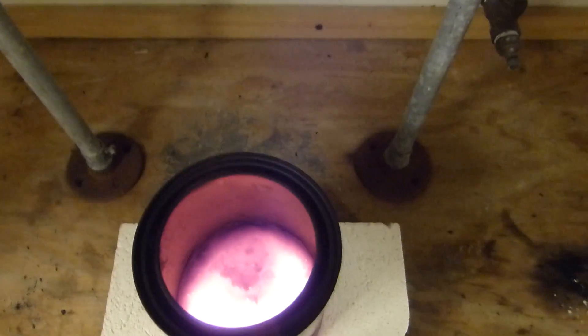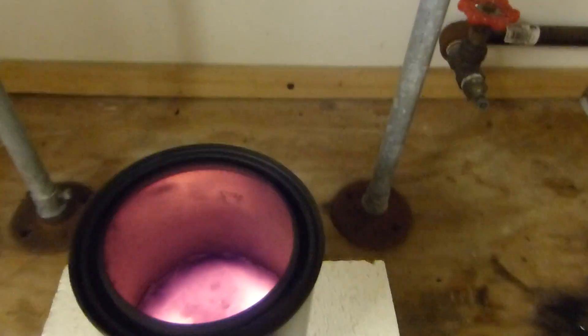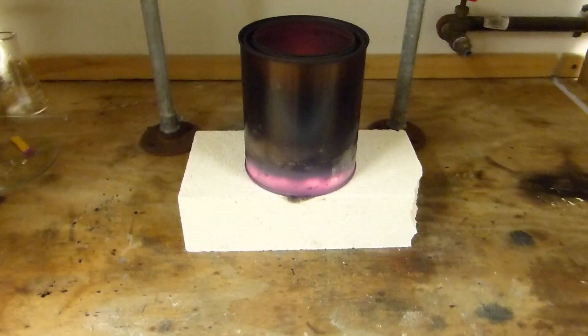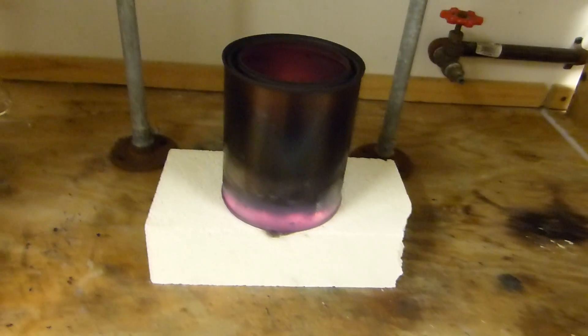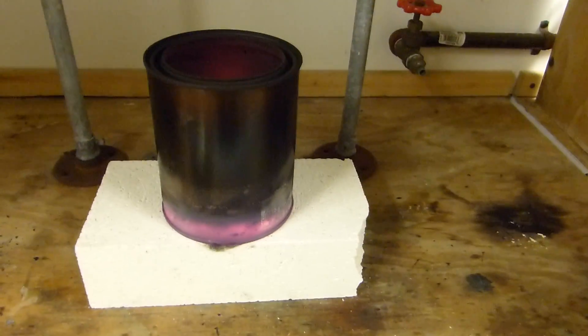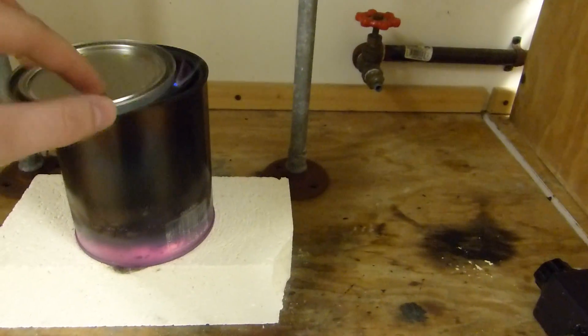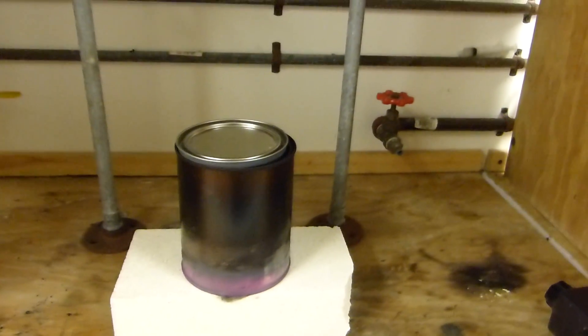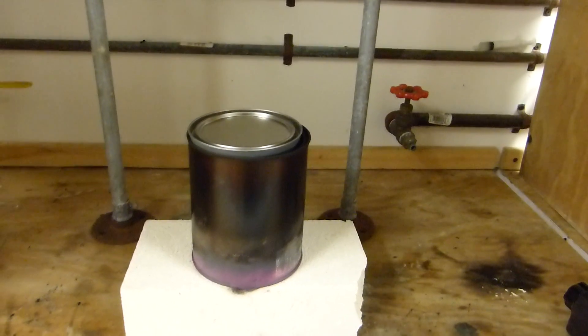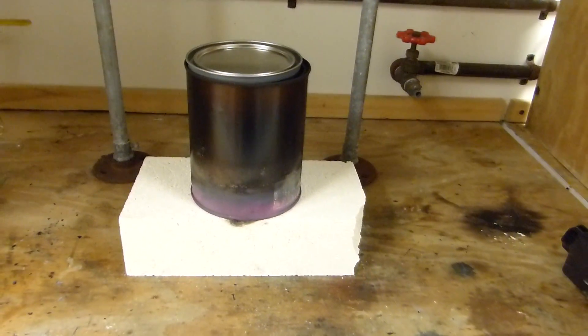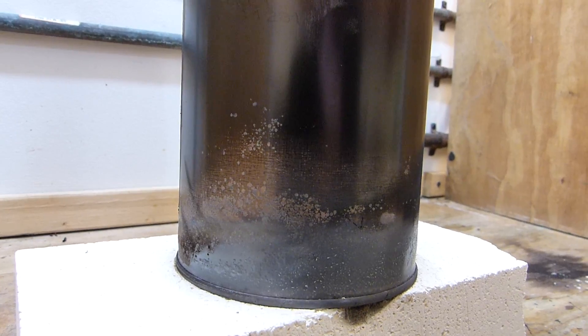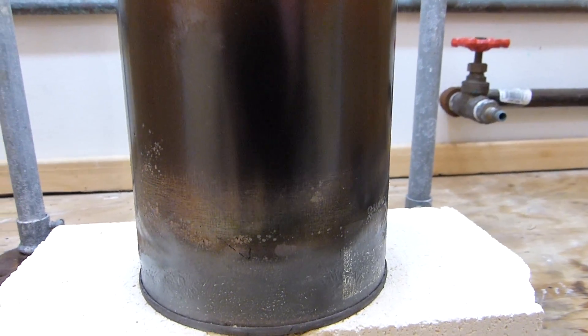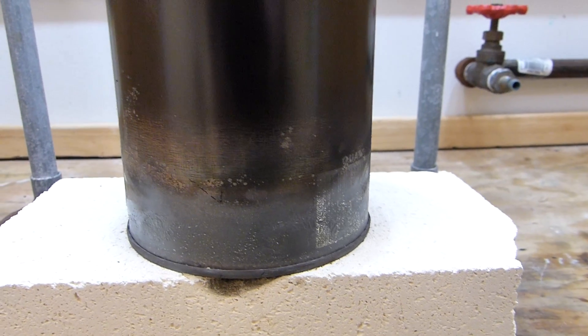And in there we should be able to see, yep, there's some really hot iron sulfide. Now I'm actually going to put the lid on to minimize this contact with the atmosphere, although it really doesn't matter. And that will just sort of protect it a little bit while it cools down. You can hear it crackling as it cools down and splits up. There's still quite a bit of heat coming off, but I can feel it on my face.